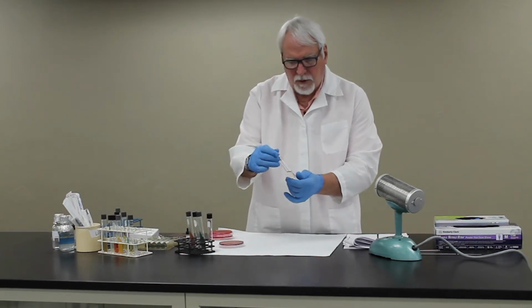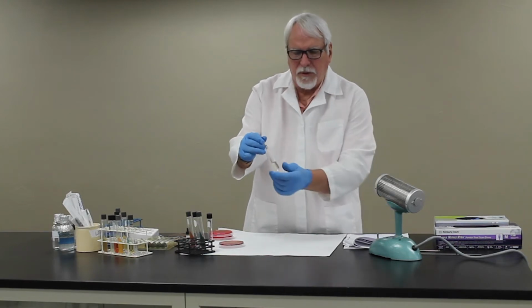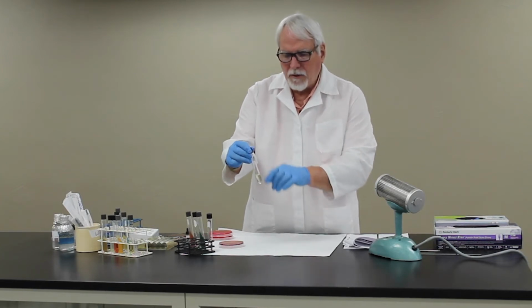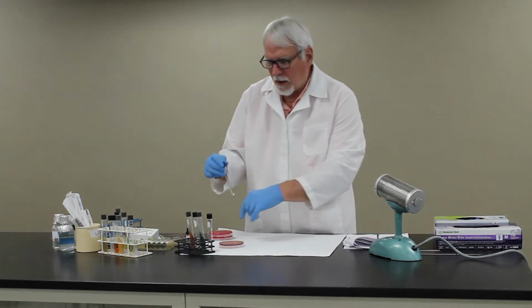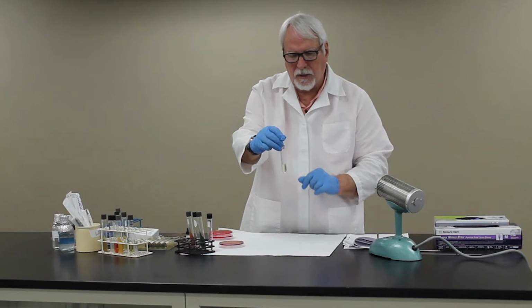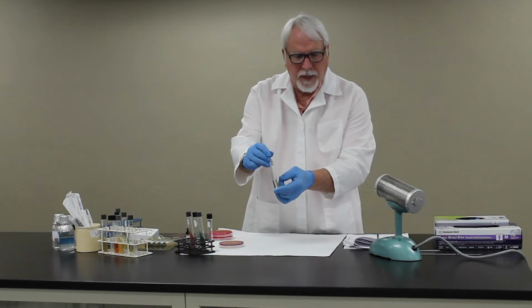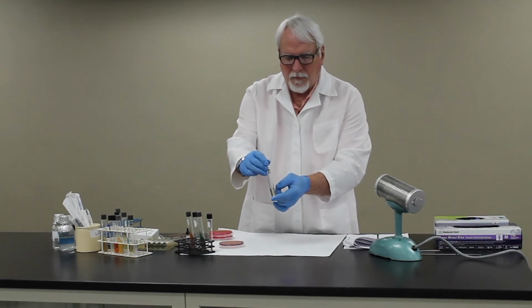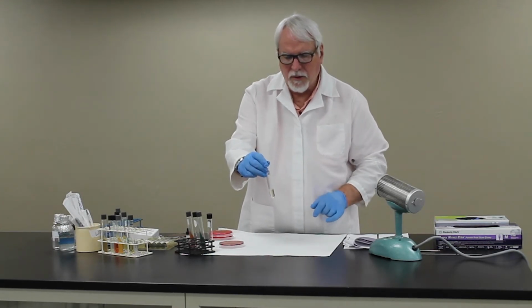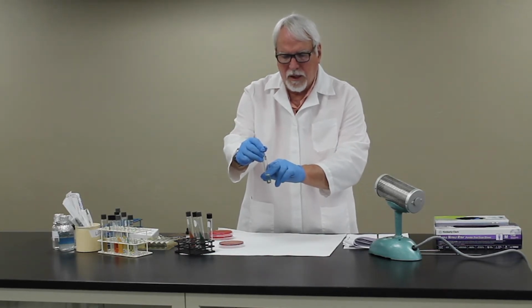And then also a real important medium with this group is the Indole Test, and we do the Indole Test in tryptone or tryptose broth. You'll inoculate this broth just like we inoculate the phenol red, just by putting your inoculum in there and twisting it around. This will then be incubated overnight, and we'll come back after 24 hours and add a reagent called Indole Reagent.